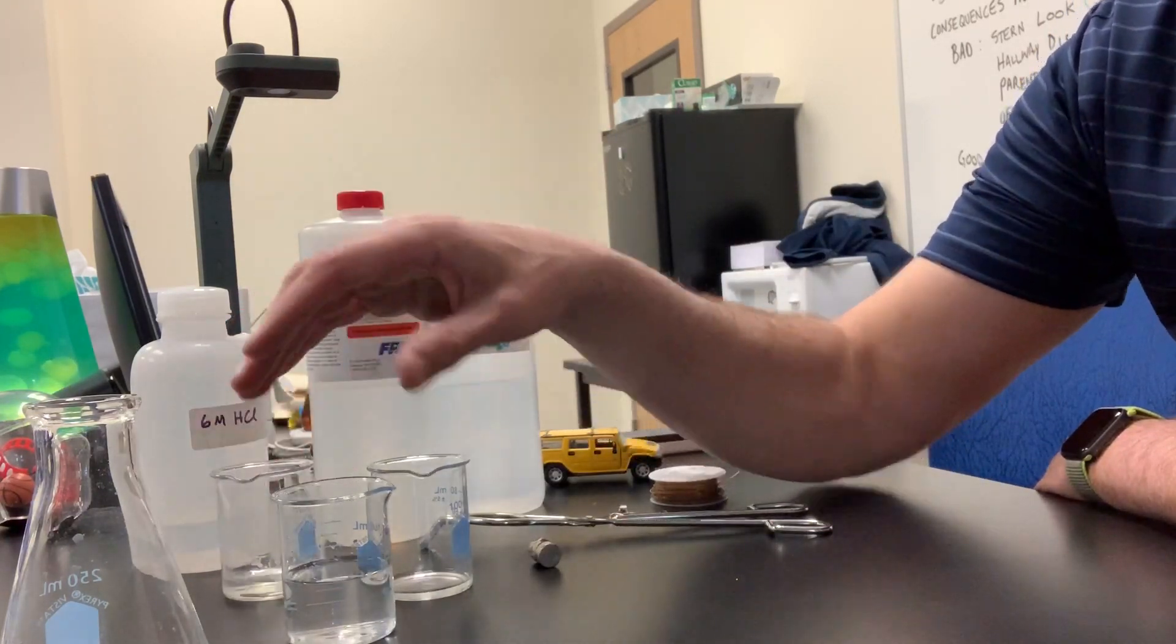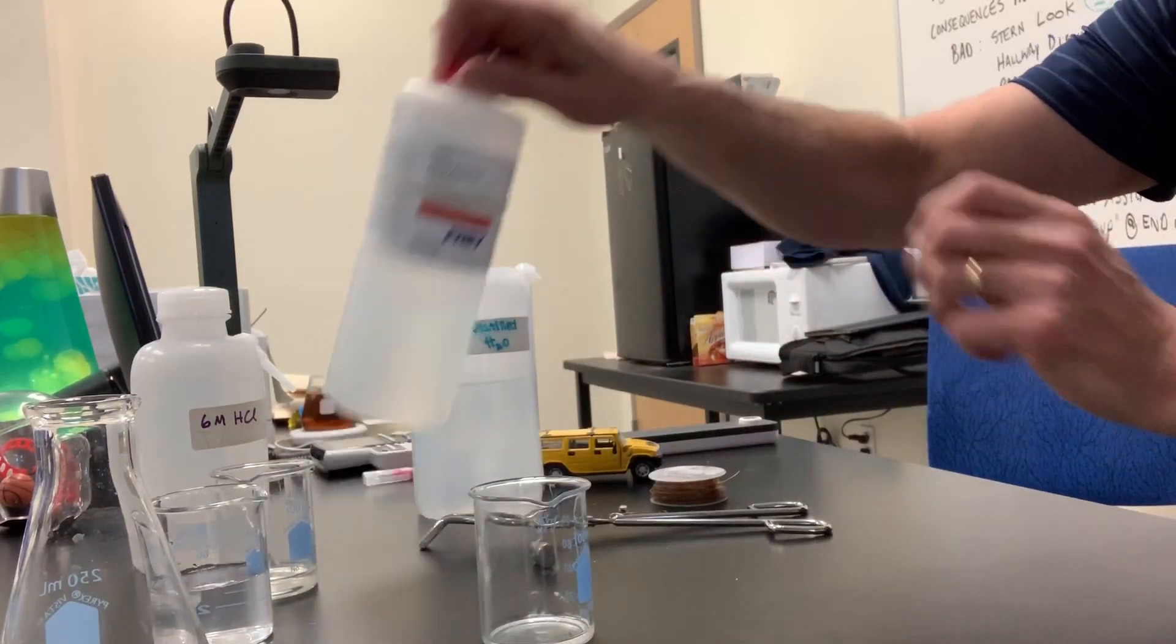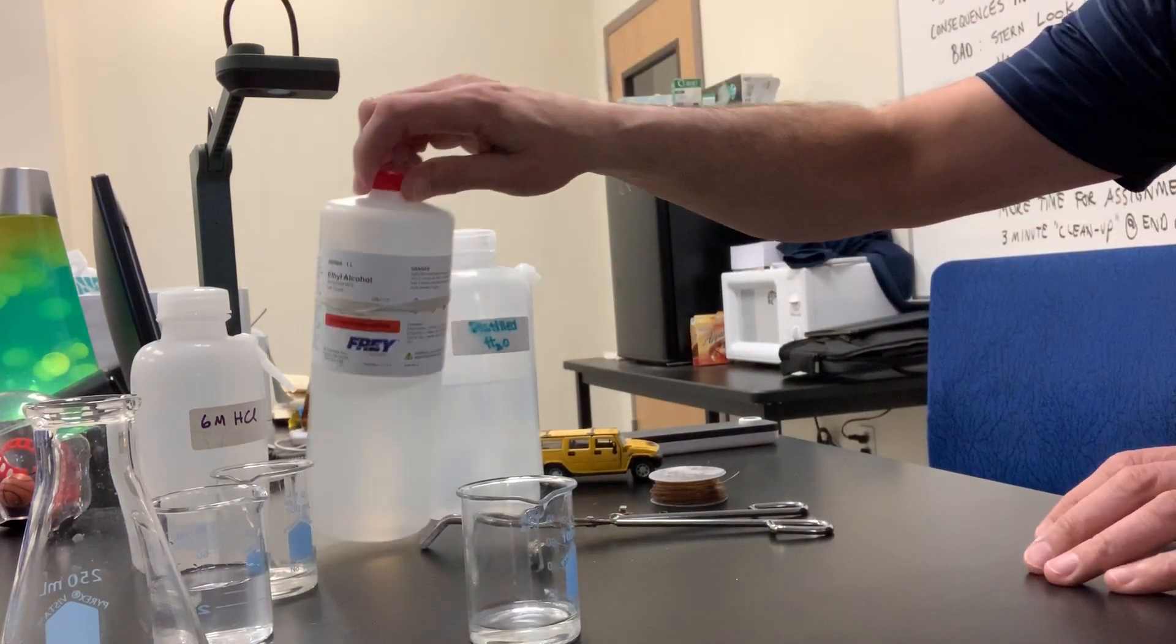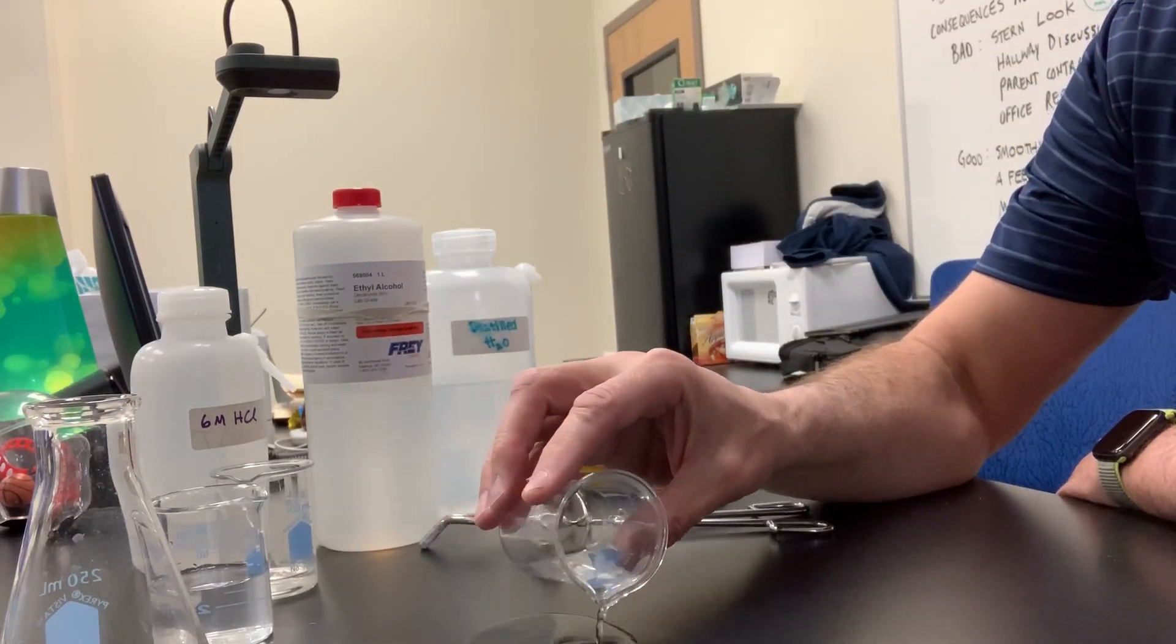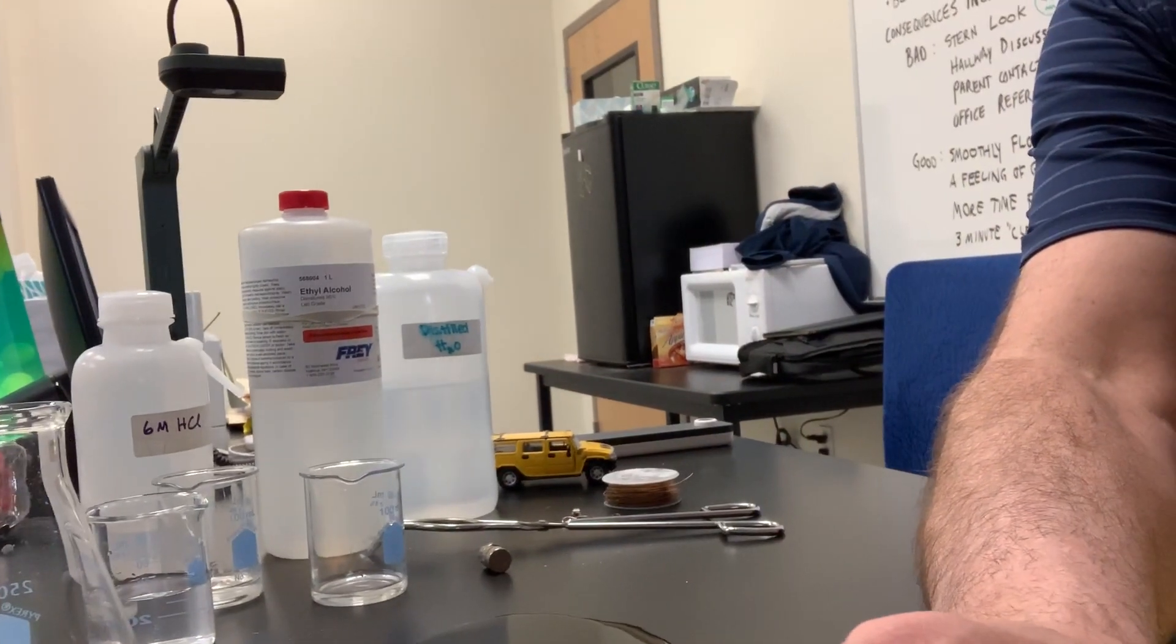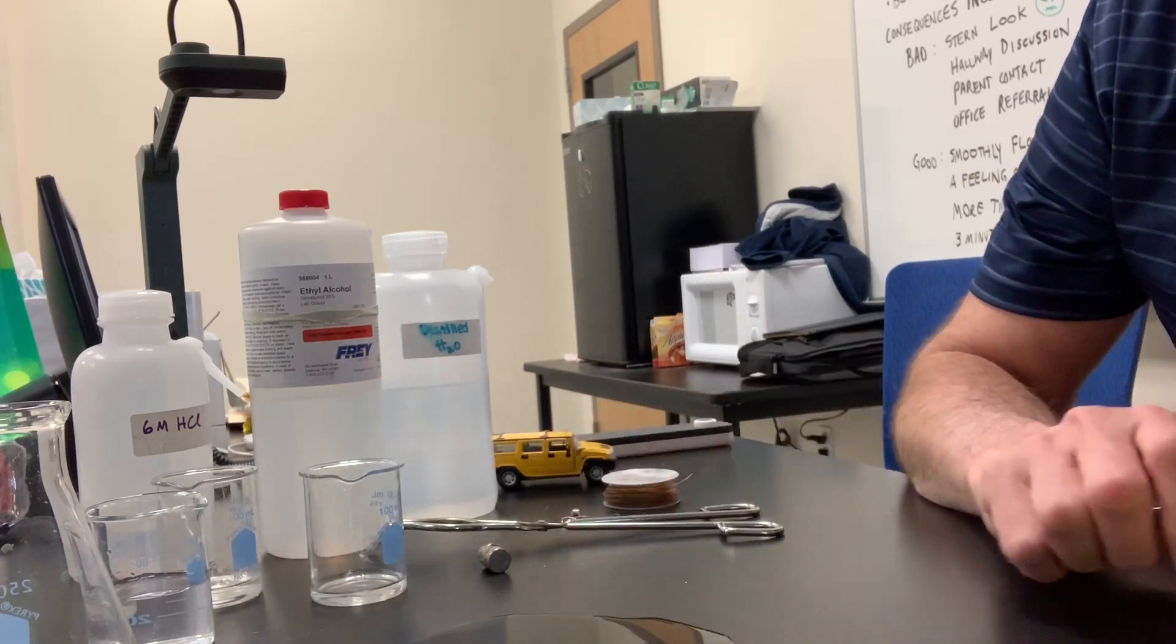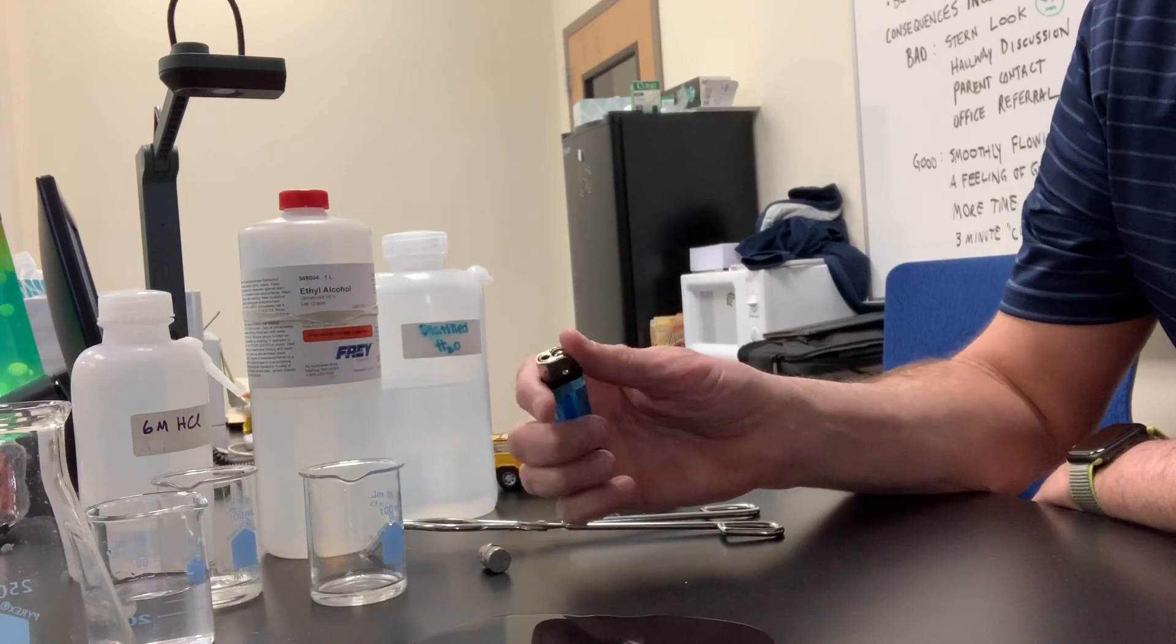Okay. The last one. Let's see if it is flammable. So we'll put a little bit more in this beaker. We'll make this a bit more exciting. Well, maybe I gave away the answer. Let's put some ethanol in that beaker. And this time, let's go ahead and pour it on our tabletop here. And let's make sure you guys can see it. And we have a little lighter here. And we'll see if ethanol is flammable. You ready? So I'm going to light my lighter and just touch it to the alcohol. We'll see if it burns in air.